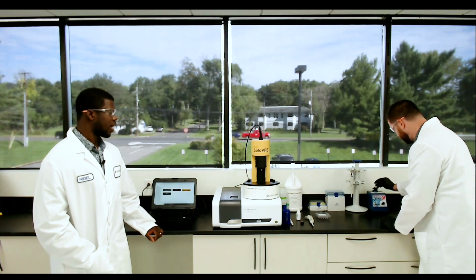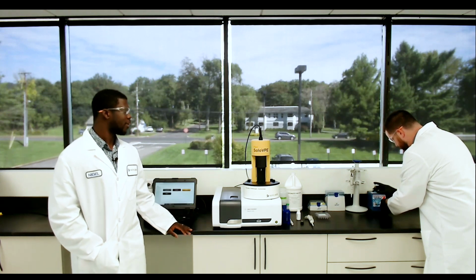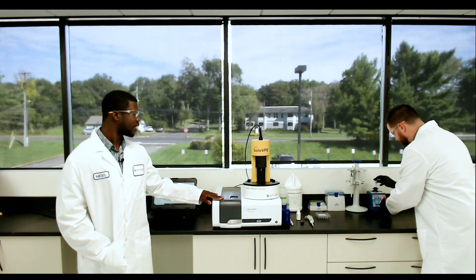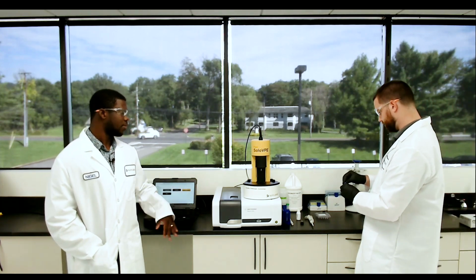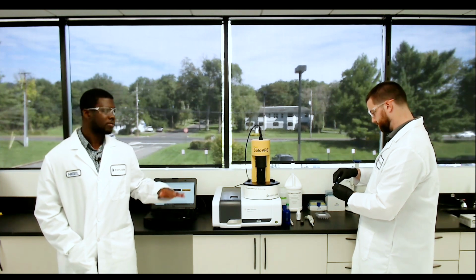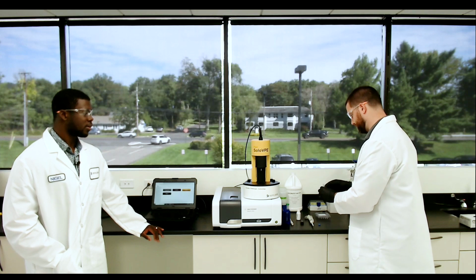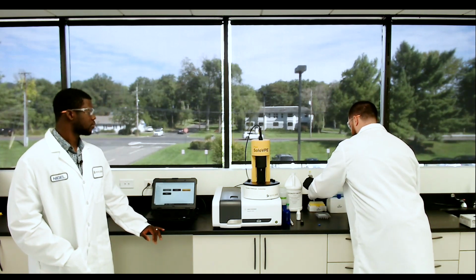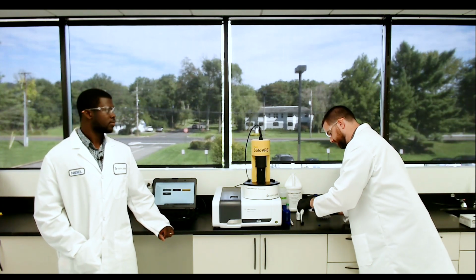I also wanted to note that it's very imperative for you to wear gloves when you're inserting fibrettes or doing anything with the SoloVPE system, since it is light-based, so any oils from your hands can really contaminate the measurements. So wearing gloves is a good technique to implement. So I'm going to pipette 100 microliters into this plastic vessel.